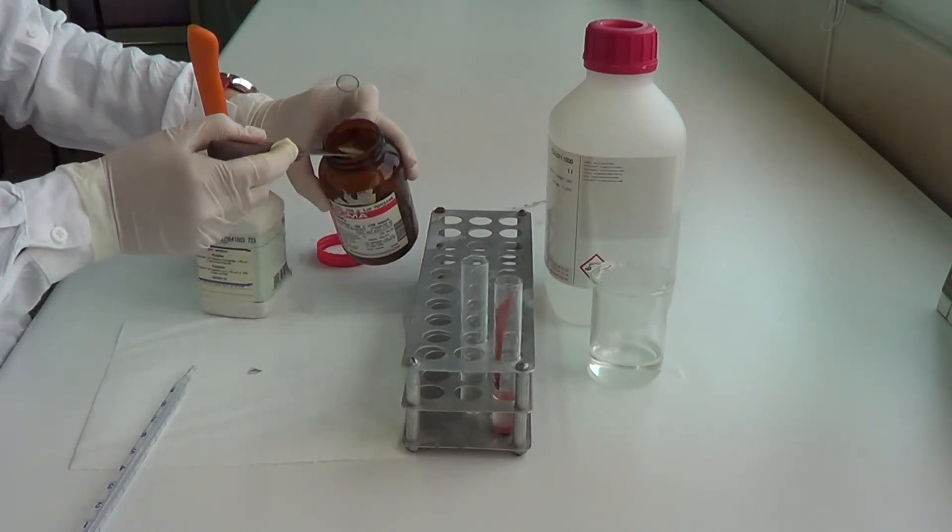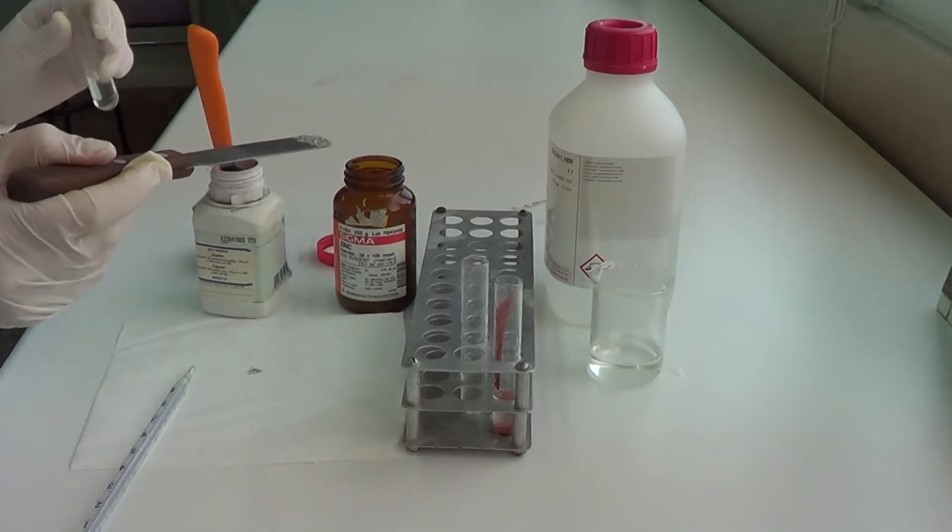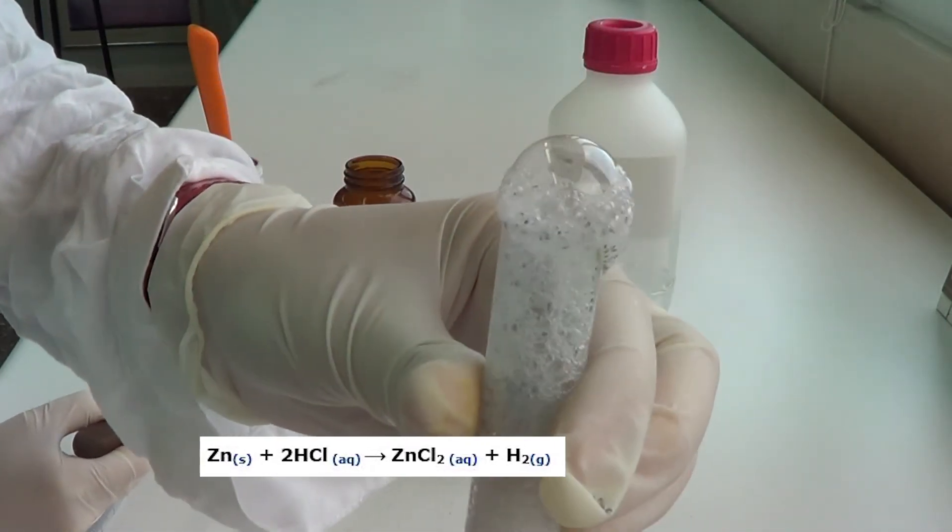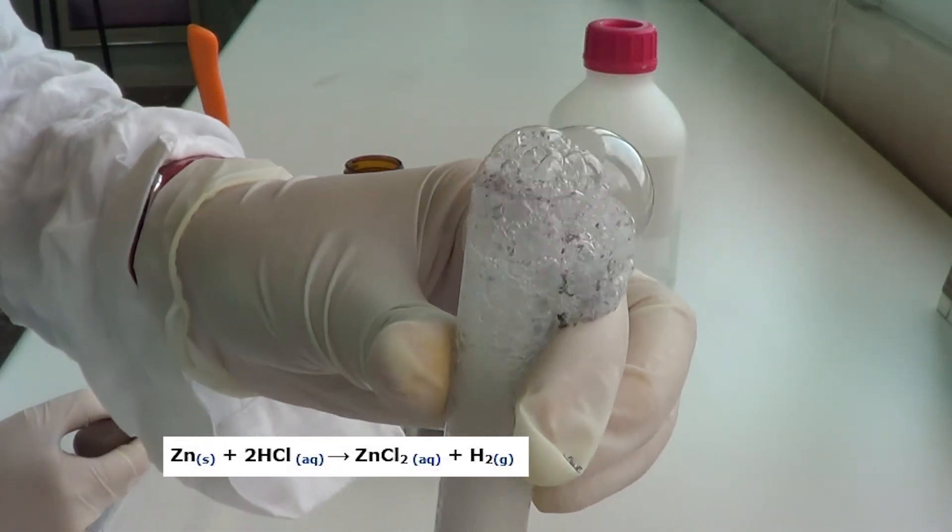We add zinc powder to the next tube. We can see hydrogen gas being released because zinc is more reactive than hydrogen.